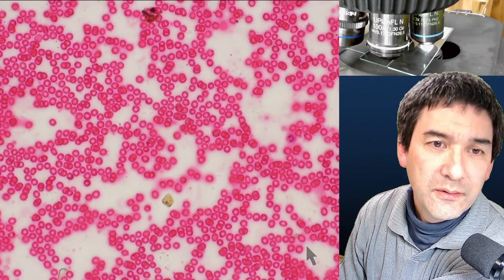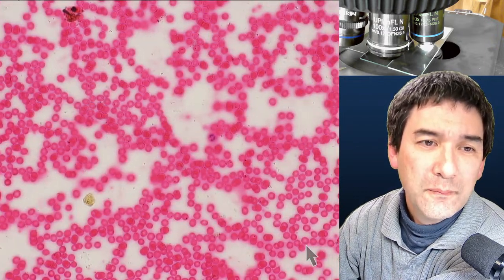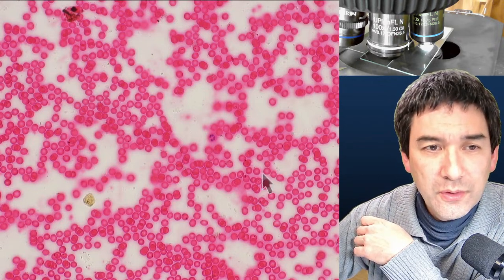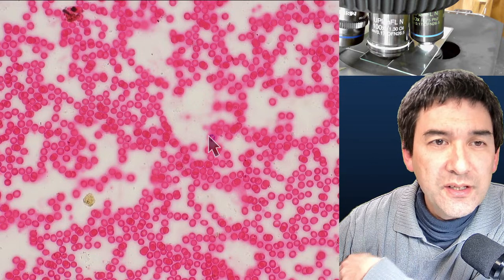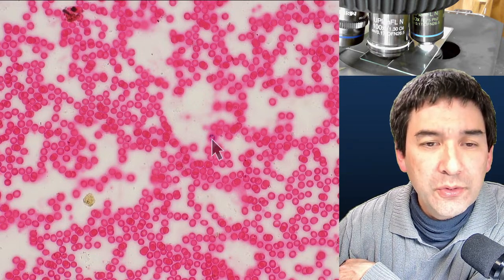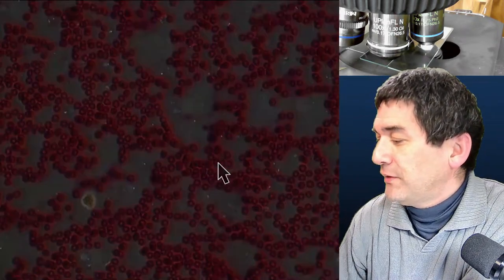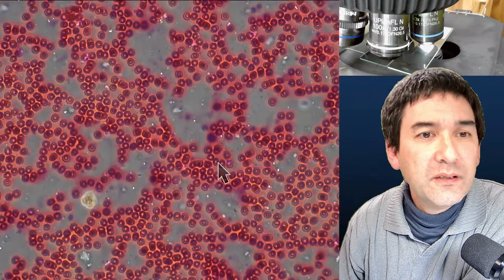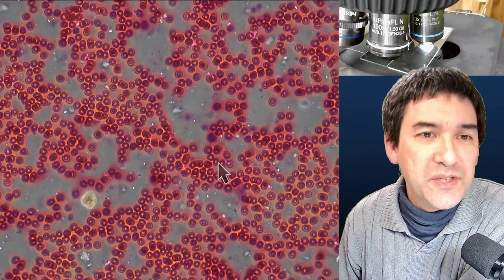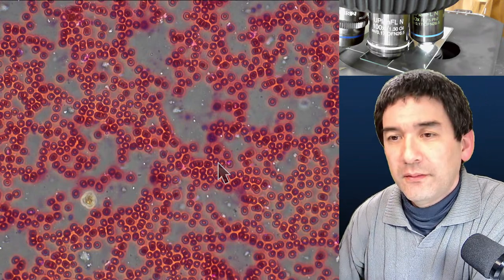Here are human red blood cells — a permanent mounted stained slide. They look like little donuts, bright in the center with a dark edge. There's also a white blood cell visible here — you can see the dark lobed nucleus inside, stained so you can distinguish different cell types. That's why blood is stained — to differentiate cell types.